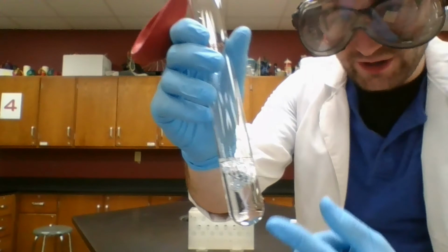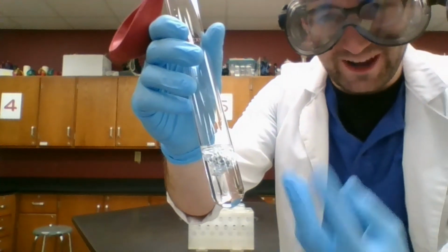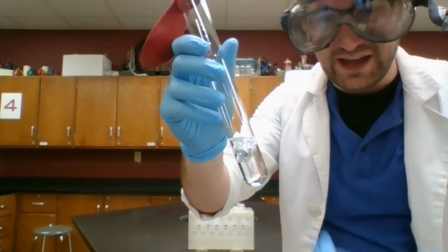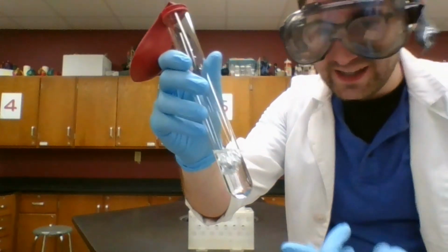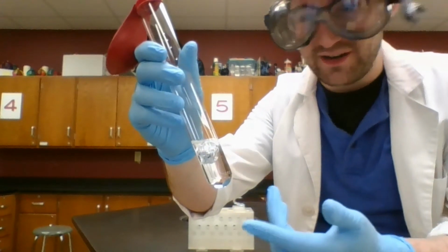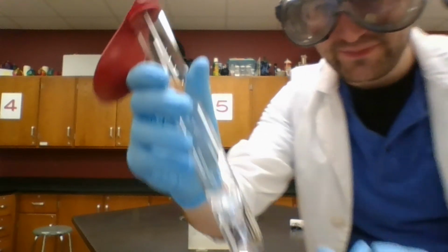You notice that it's now floating, as some kind of fizz is coming out. Now, this isn't a gas that's trapped somewhere in the liquid. It's a totally new substance. We put together a liquid and a solid, and all of a sudden we get gas.